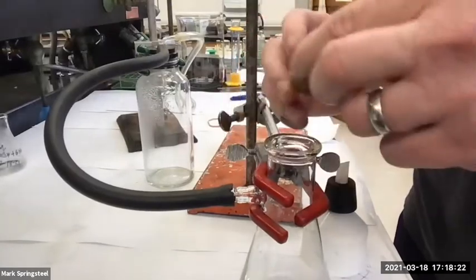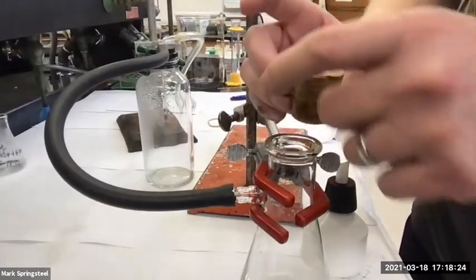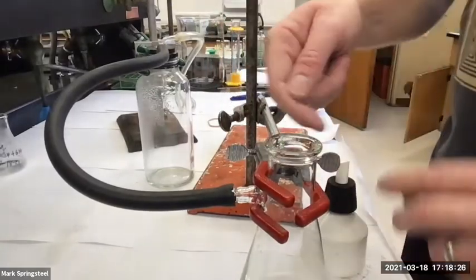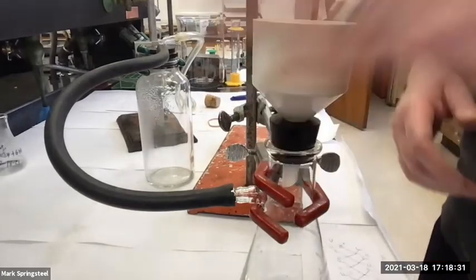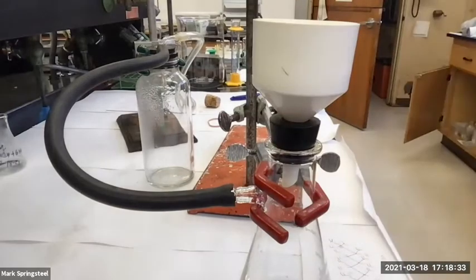If you don't check the big end first, sometimes it's too small and falls in there, and then it's like a puzzle to get it out. It drops right in, no problem, but when you're trying to pull it out, you have to get it at just the right angle. You're usually using a micro spatula, and you've got to fish it out.